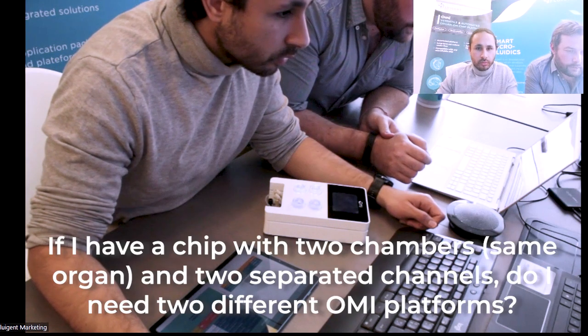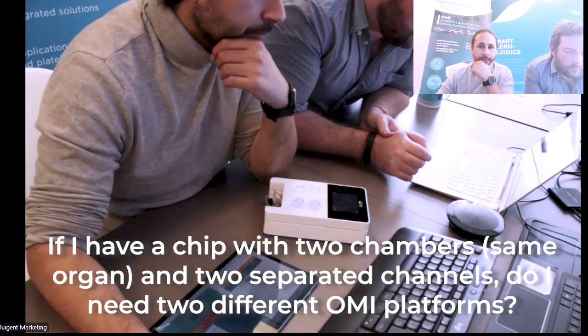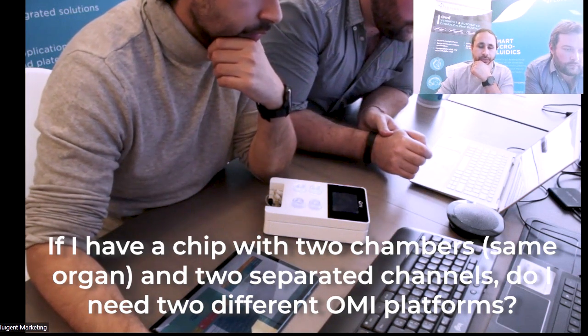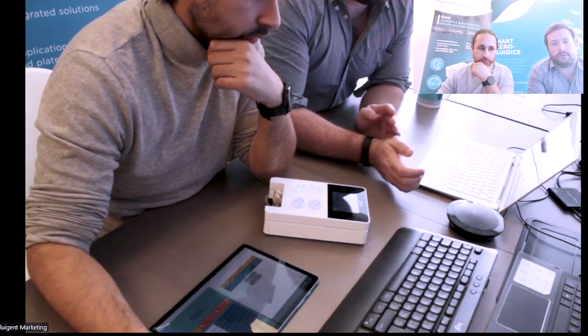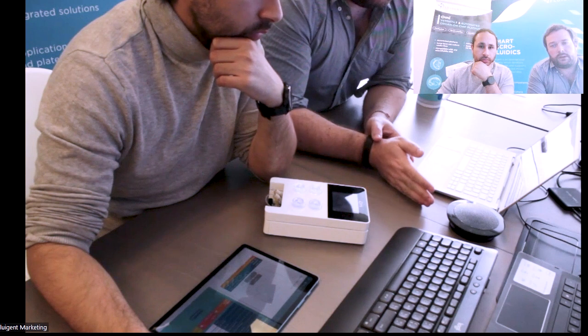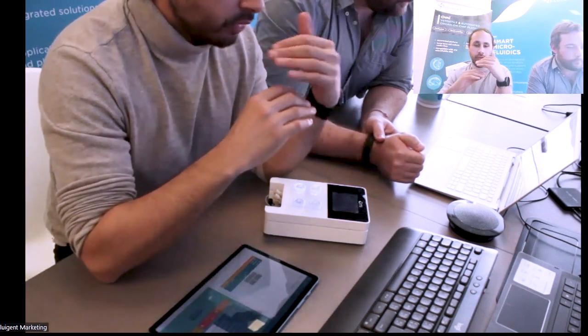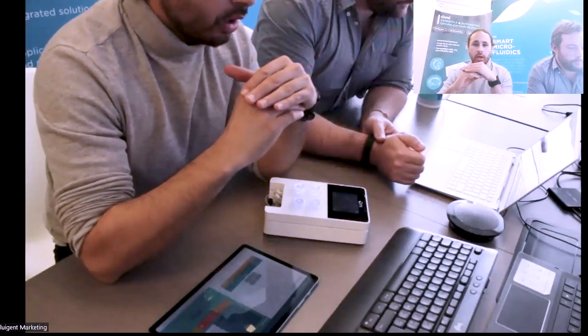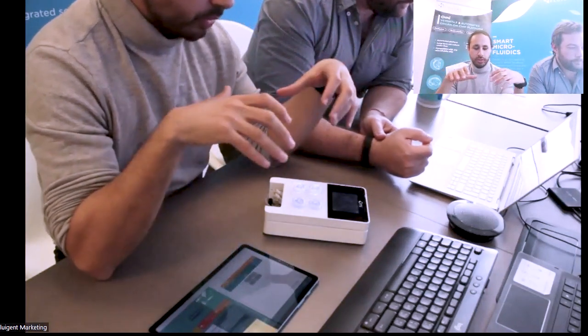To understand well, if I have a chip with 2 chambers and 2 separated channels, do I need 2 different OMI platforms? So yes. Basically the philosophy of OMI is 1 OMI per channel. So if you're making a co-culture, with 1 channel at the top and 1 channel at the bottom, you will need 2 OMI synchronized.